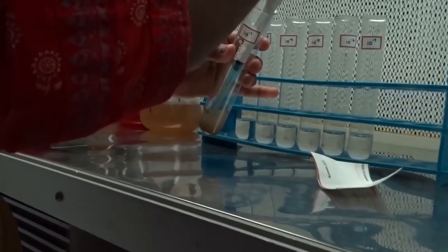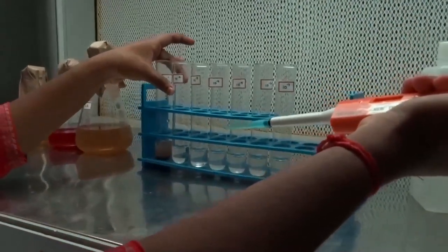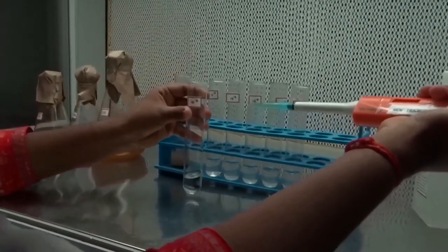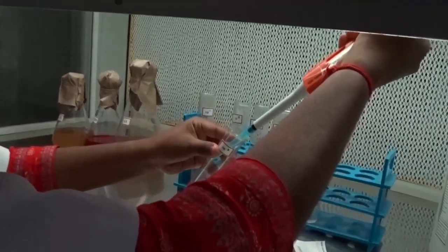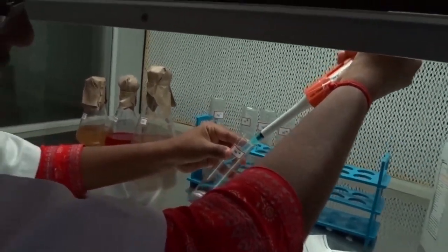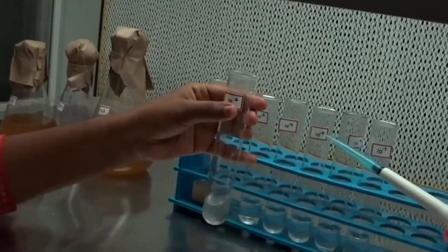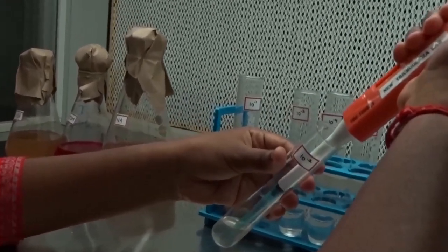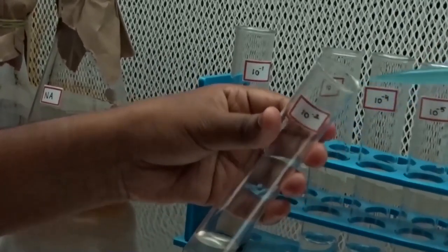Take 1 ml of suspension from the 10 to the power minus 1 dilution and add to 9 ml of sterile distilled water. Subsequently, make dilutions till 10 to the power minus 7.